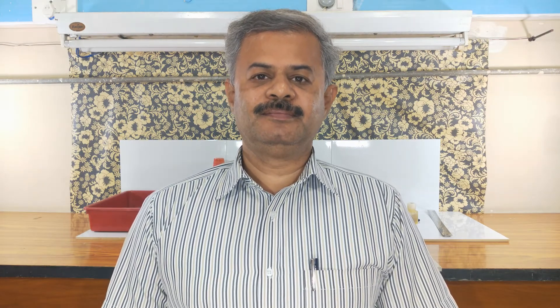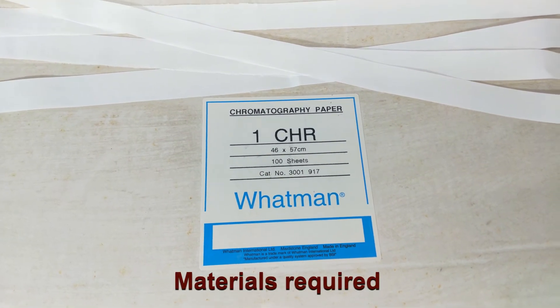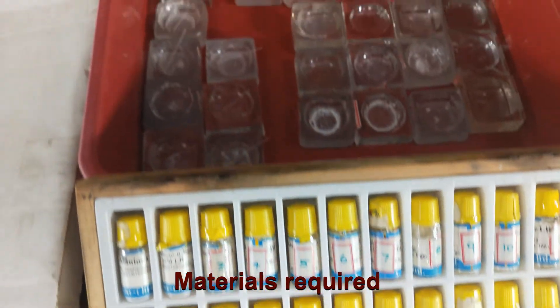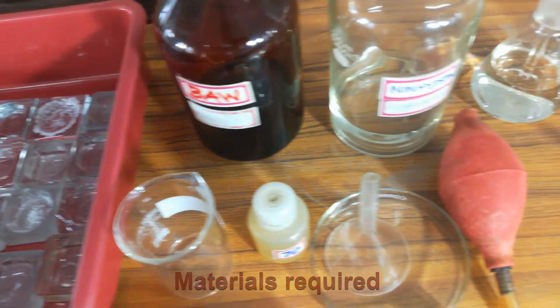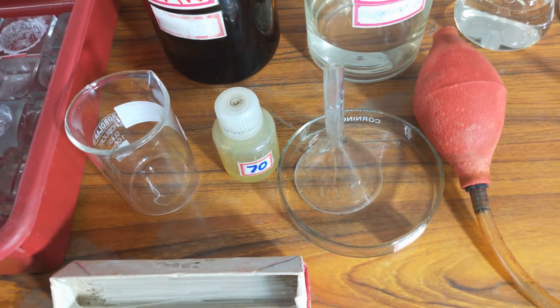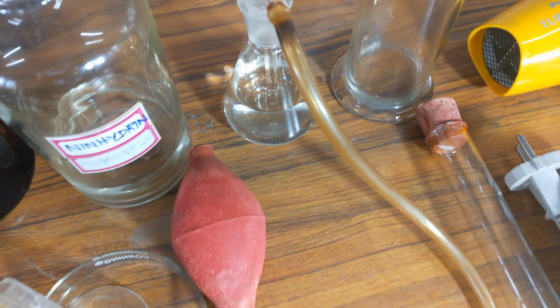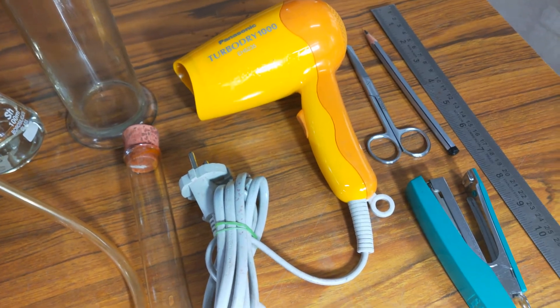Now we shall see what materials are required. We need Whatman number one chromatographic paper, amino acid kit, embryo cups, solvent — butanol acetic acid water — ninhydrin solution, 70% alcohol, beaker, funnel, Petri dish, capillary tube, sprayer, specimen jar, boiling tube, hair dryer, stationary items, and a chromatographic chamber.